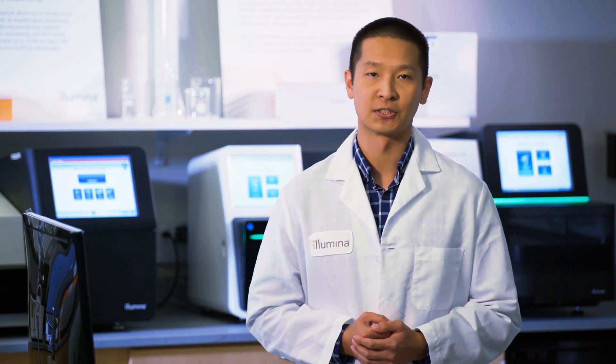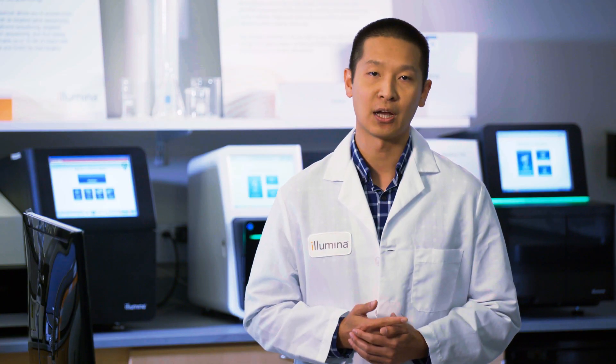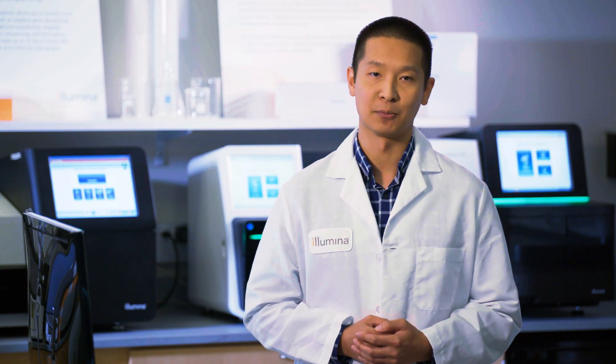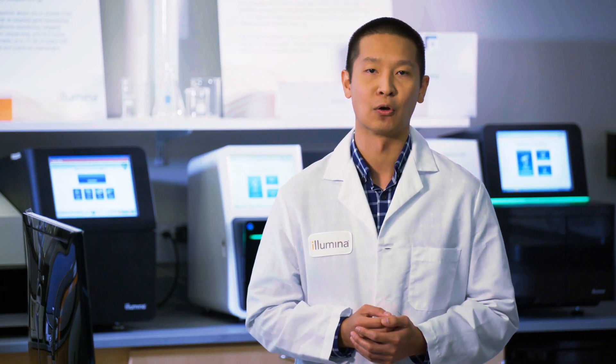The first step is designing your custom panel using Design Studio. Design Studio is a free and easy-to-use tool that allows you to create custom enrichment and amplicon designs. It's fast and provides high target coverage for even tough-to-design regions. The program is simply accessed through the Illumina website. With AmpliSeq for Illumina, you can design panels from 12 to more than 12,000 amplicons, in general up to four pools. If you have questions or issues anywhere along the way, technical support and concierge design service experts are always available to help.